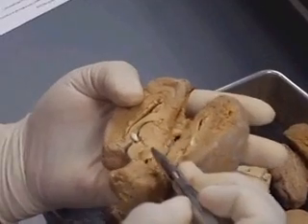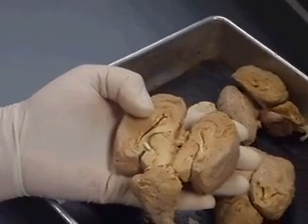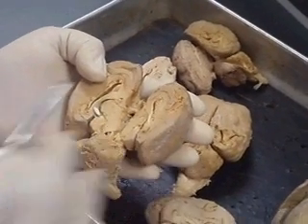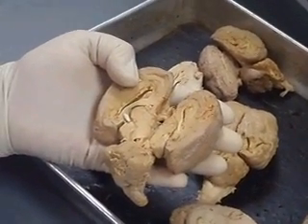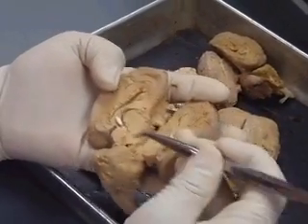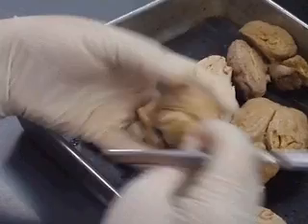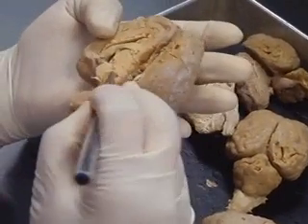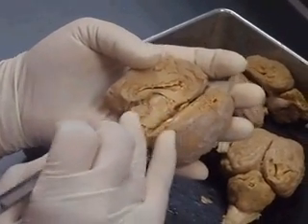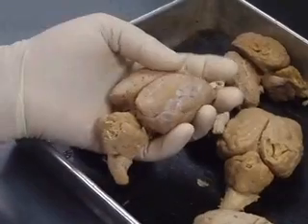This is still our hypothalamus here — remember we saw the hypothalamus right below. The hypothalamus lies ventral to the thalamus. This is thalamus; this is your hypothalamus. The narrow cerebral aqueduct leads through the midbrain and connects the third and fourth ventricles. You can kind of see it right there. If this is the third ventricle and then your fourth ventricle here, there is another channel that connects them — that's the cerebral aqueduct going right through your midbrain, the mesencephalon.